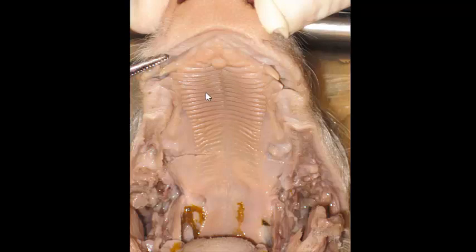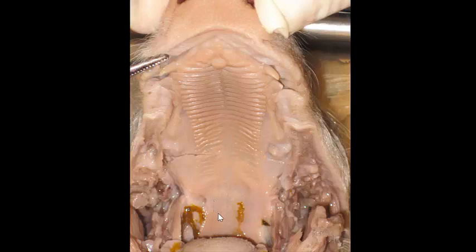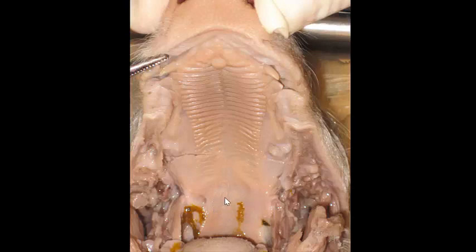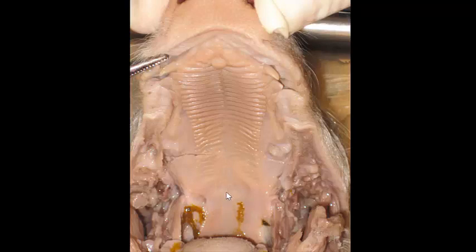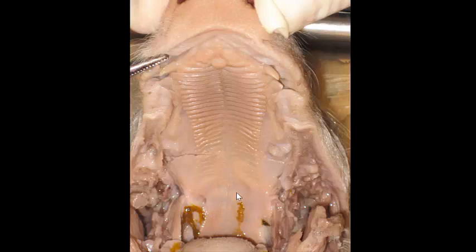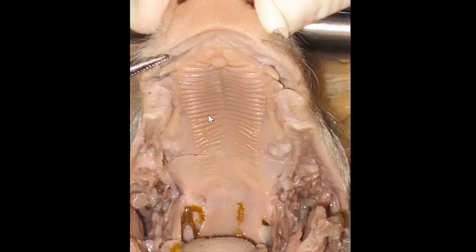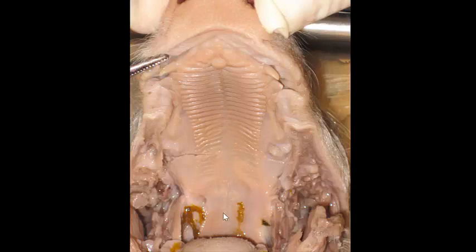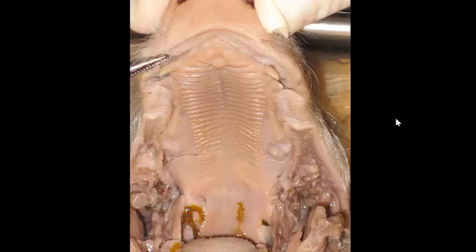I already mentioned hard palate. The only other oral digestive structure is back here — this would be soft palate. If you feel it with your fingers or touch it with a probe, you'll notice that the front is very hard — hard palate — and then back here it's really soft — soft palate. So those are the oral structures.